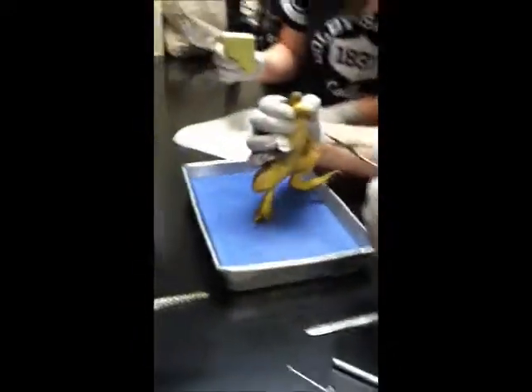Let's go away. Do you want to put it here? No — a hinge joint. A hinge joint at the mouth. It's the edge of the mouth. This is animal abuse. Who cares? It's dead. Cut it.